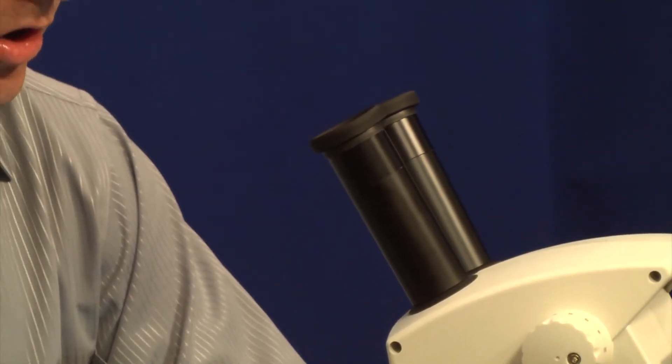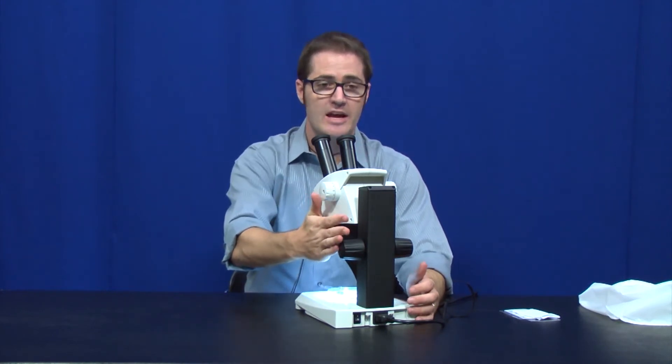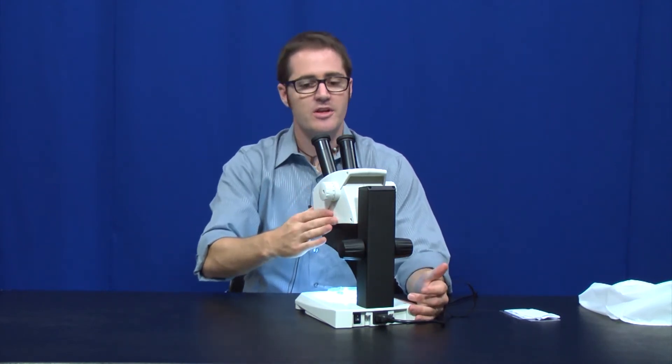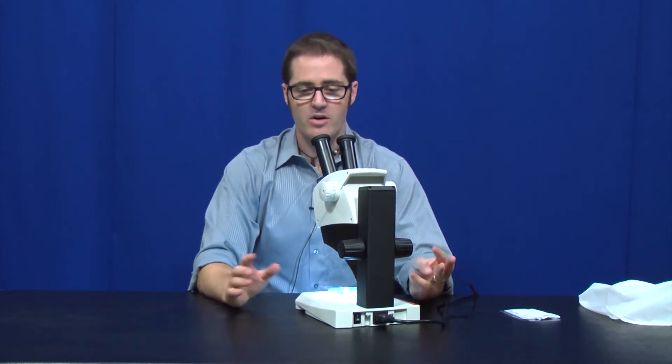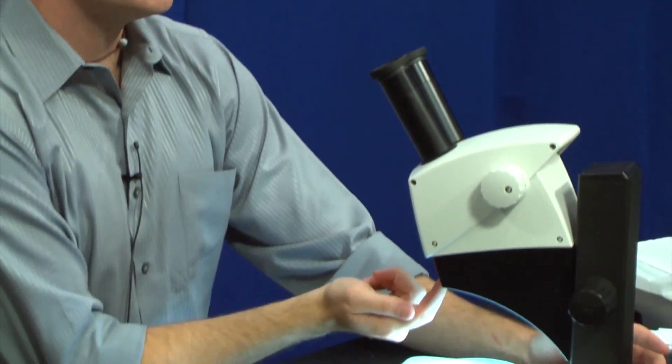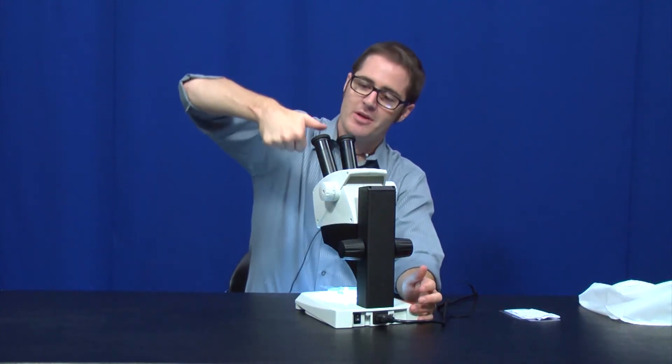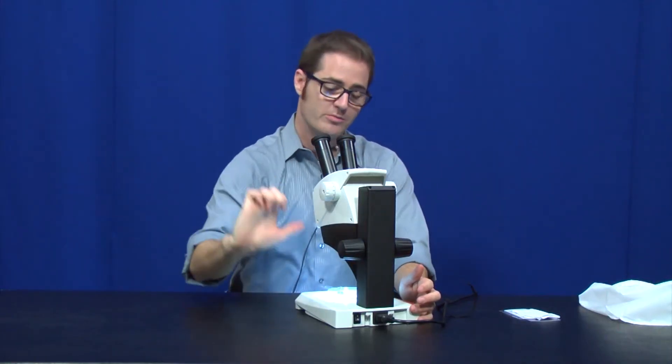With this microscope, we shouldn't see any illumination issues. All these microscopes are LED based. They've got a 25,000 hour life. I actually ran the numbers once. I believe if you were to use it eight hours a day, five days a week, you'd get like 18 years out of it. If you do happen to look through the microscope and you're not seeing a crisp, clean image, even after you focus and you can't seem to get the image in focus, it's likely that something is dirty. There's only two places on this microscope where things can get dirty, and they're the ones you would think.